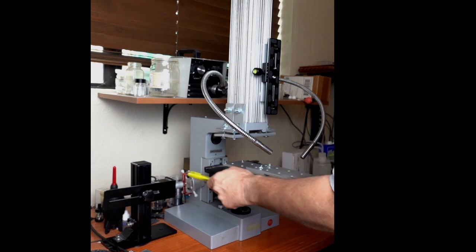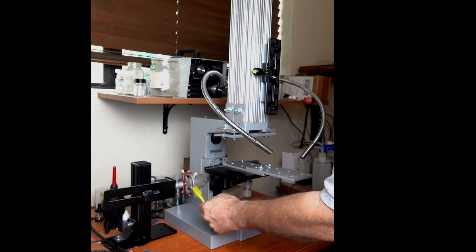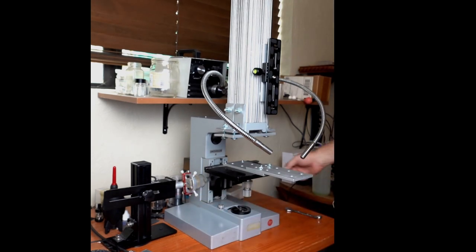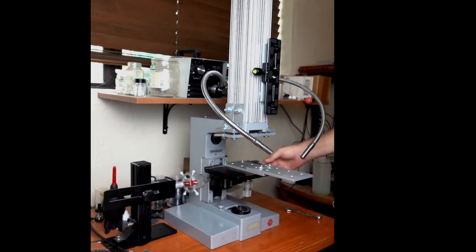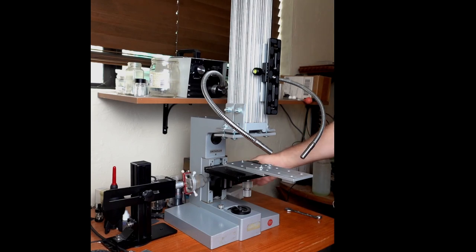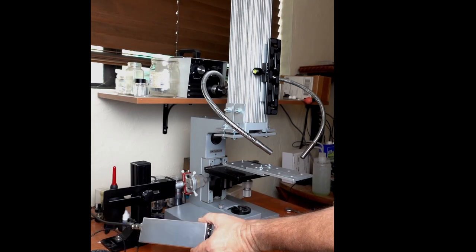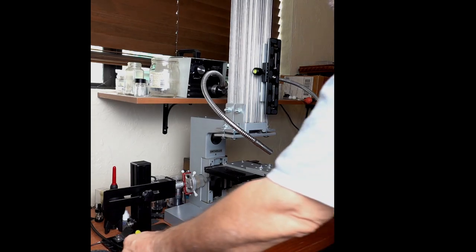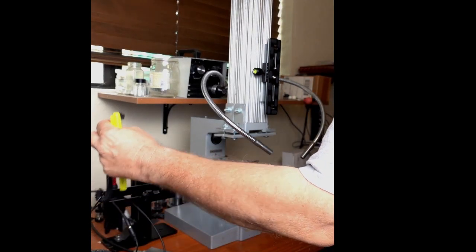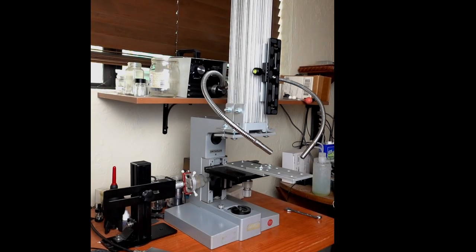Basically, there's a stepper motor here with a flexure and then this U-clamp with some nylon screws which you can screw down onto the focusing knob. So now the controller is able to give you very fine control of the focusing knob. The controller, which is here, also purchased with this Micromate unit, is Bluetooth enabled and you operate it from your smartphone. It also has a trigger here which connects to your camera so it will trigger the shutter on the camera.